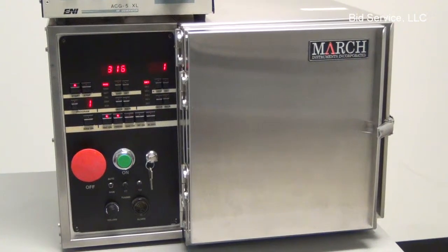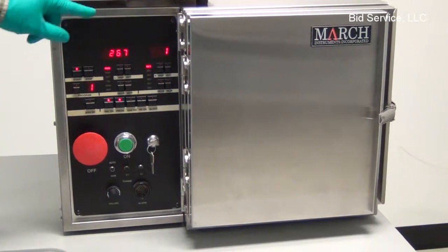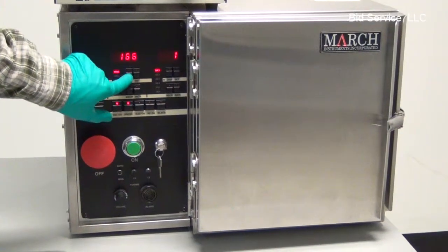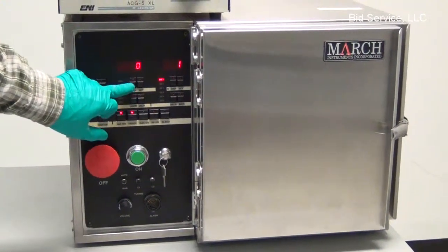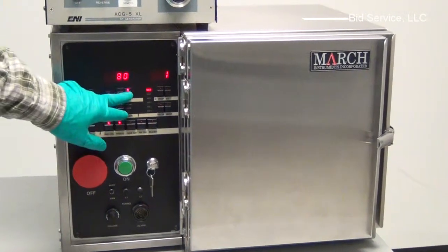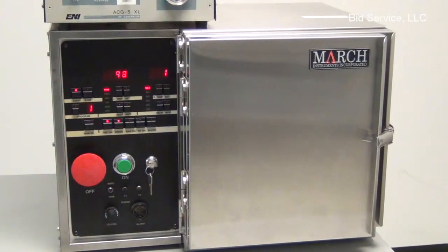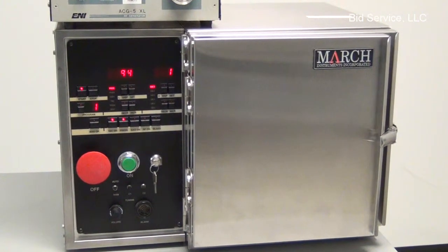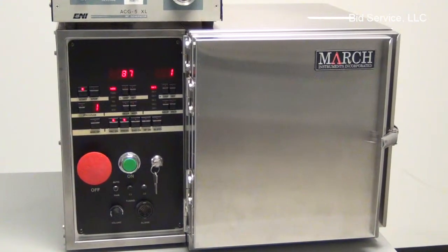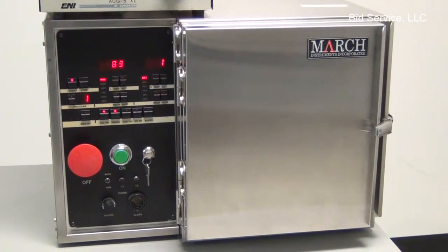There it is now. So in that short amount of time, it pumped down to 300 millitorr. Now it's bringing it down. It's going to look for the base pressure I have set in here, of 80, if you recall that. I have it set to 80. So once the pressure hits 80, it'll turn the gas on. It'll hit 80 and then there's a slight delay afterwards to be certain that it is below 80.